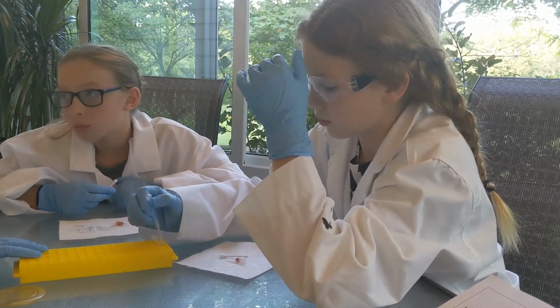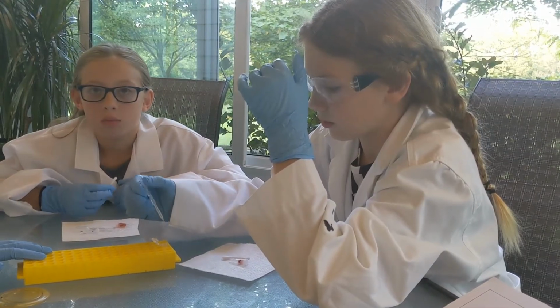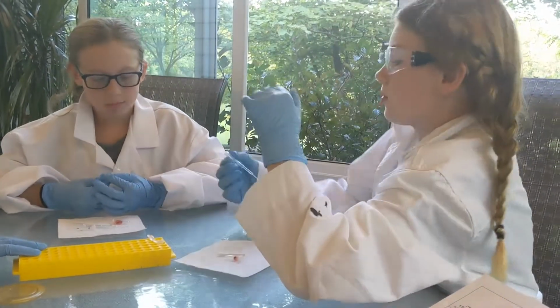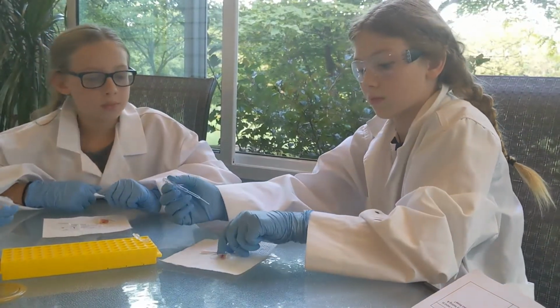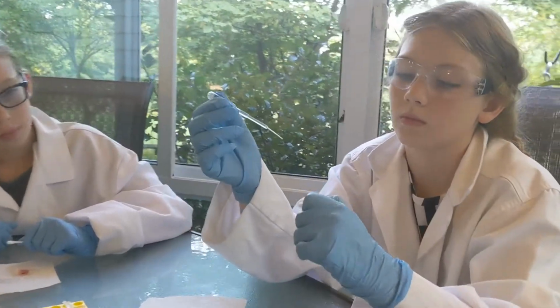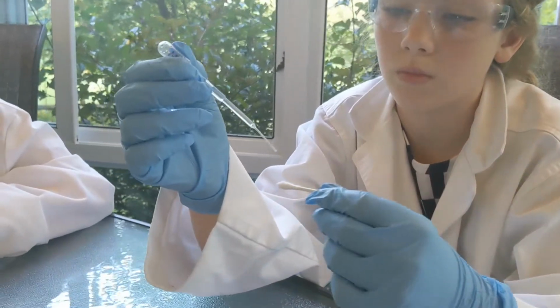Not too much. She can really suck up all of it. But don't we need some? She'll pass around the pipette, though, to each of you. So hold up your swab. There you go. Without touching it to the swab, go ahead and add a few drops of water to moisten it.